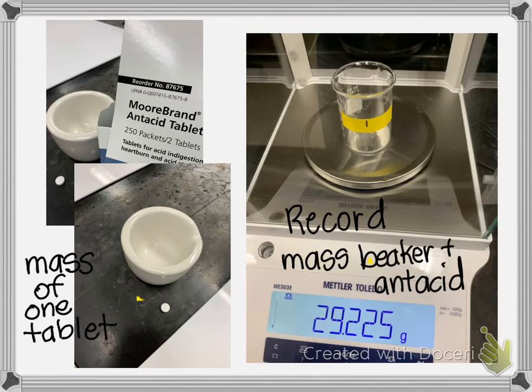The mass of one tablet is 1.448 grams. It says in your procedure, one dose, so don't multiply it by 2 or anything. That was what I had as a dose. So that's the first column. You have 2 things to record on this page: the mass of one dose and the beaker plus the antacid sample.